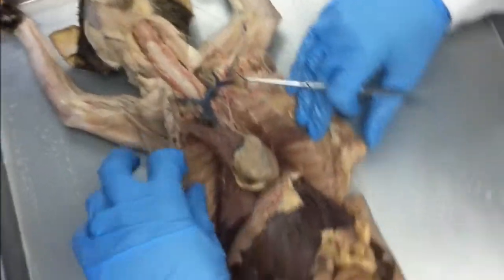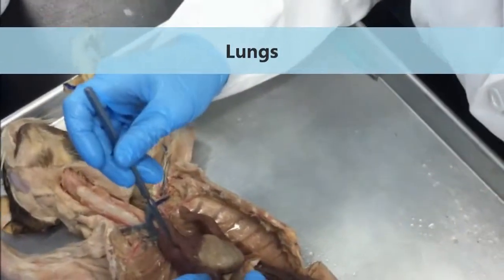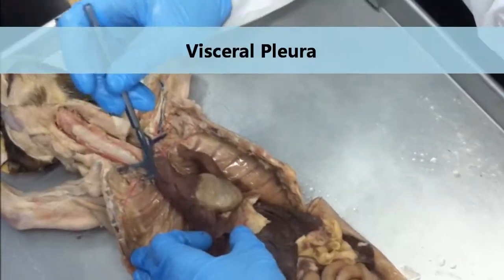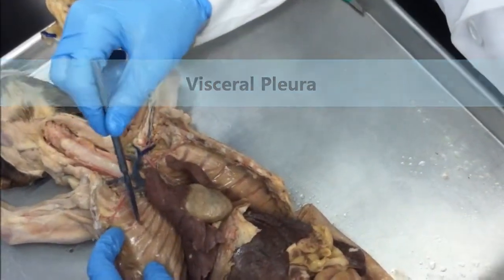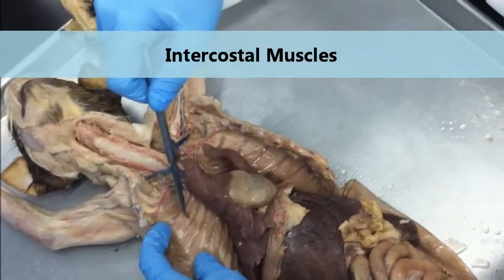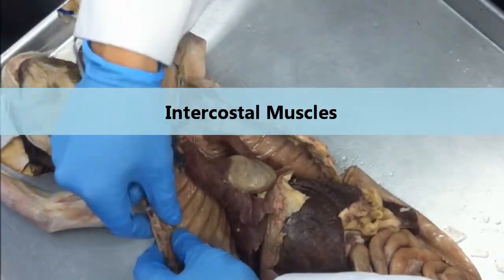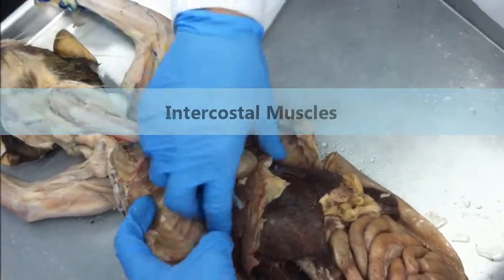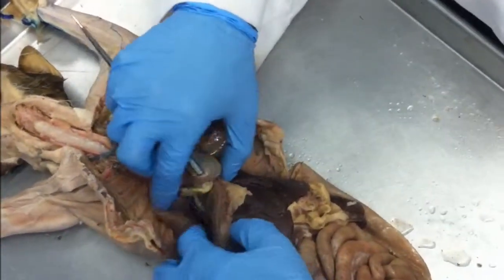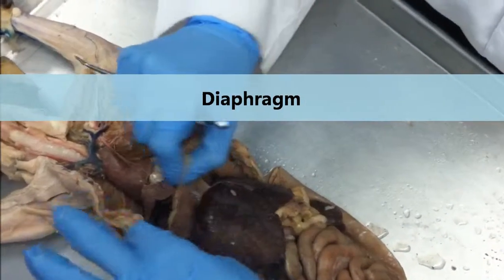And let's go down past the diaphragm. Well, first of all, you need to know what these are. What are these? Lungs. If I put a pin on the outside of the lung, what would it be? Visceral pleura. Pleura means of the lungs. If I put a pin between these ribs, what tissue would I be pointing to? Intercostal muscle. Okay, here's my costal cartilage off of the ends of my ribs. Intercostal muscle is easy to pin. Okay, what is this organ called? Diaphragm. The diaphragm, this thin layer of muscle that separates my thoracic cavity from my abdominal cavity.